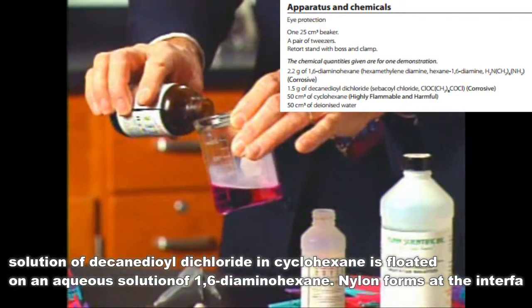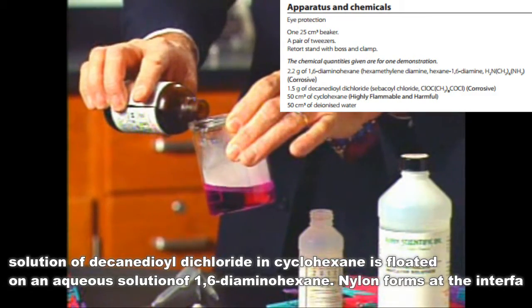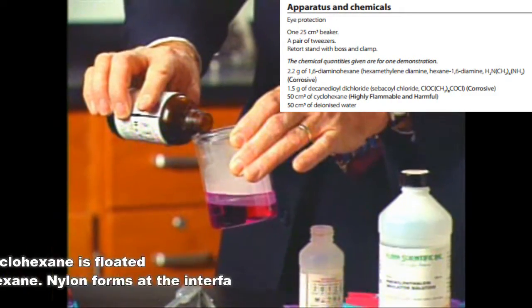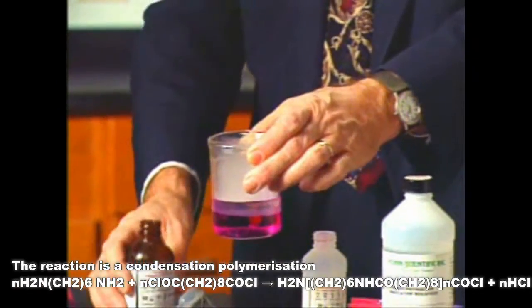We're going to pour in a second layer of another chemical. The two chemicals form two separate layers.